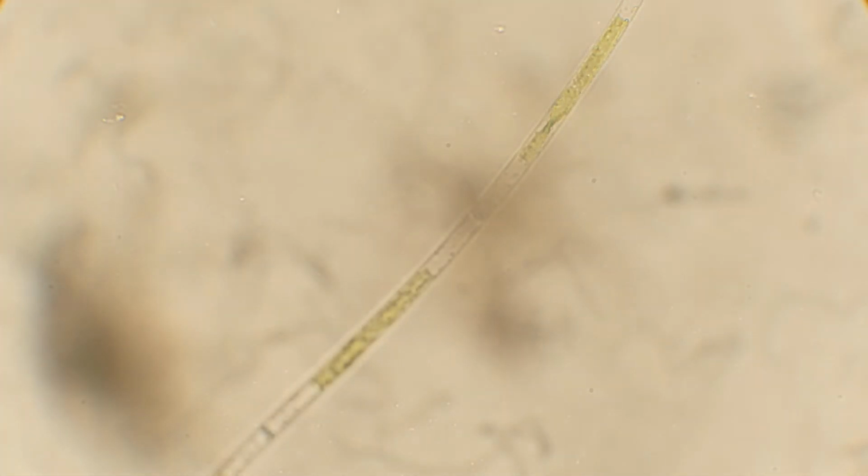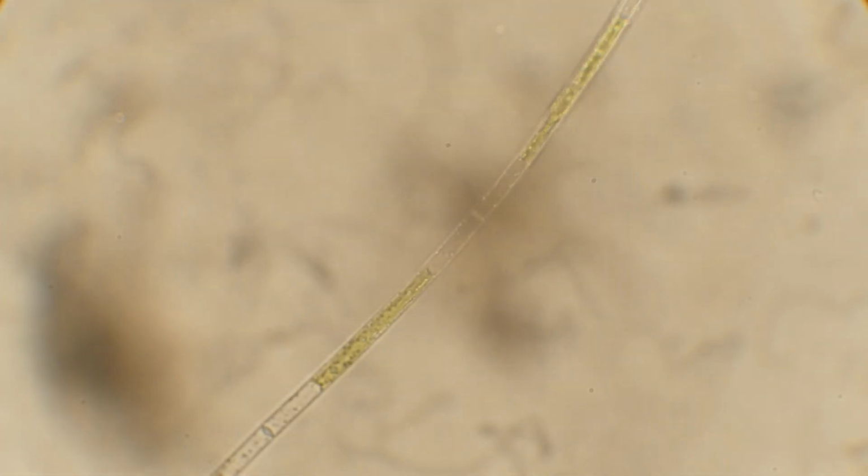And this is much more like what it looks like in the binocular view, is that it's small. So here it is at 20X, that algae. Focus a little more carefully here, right about there. And then we go to 40X. And parfocal, that's the word. It's not parfocal, the lenses, but with some adjustment, we see the algae.